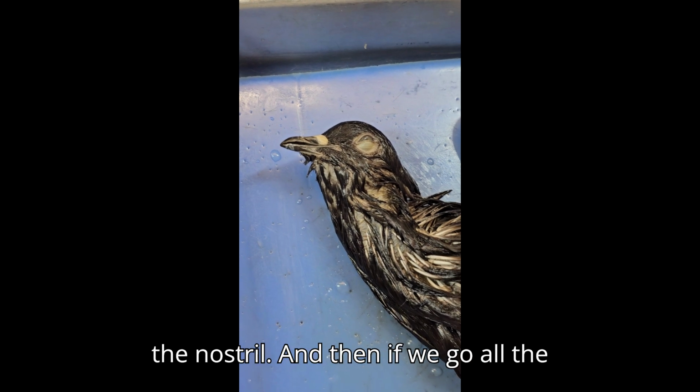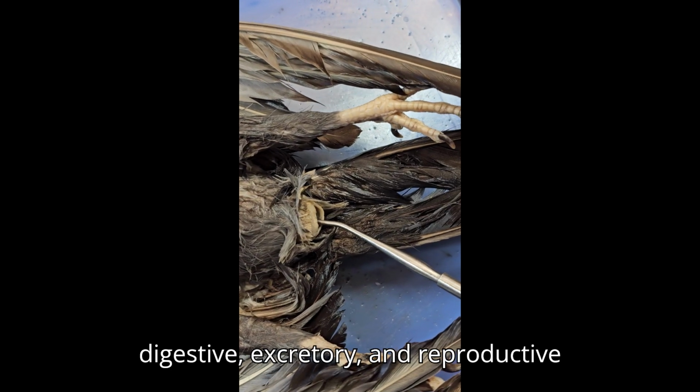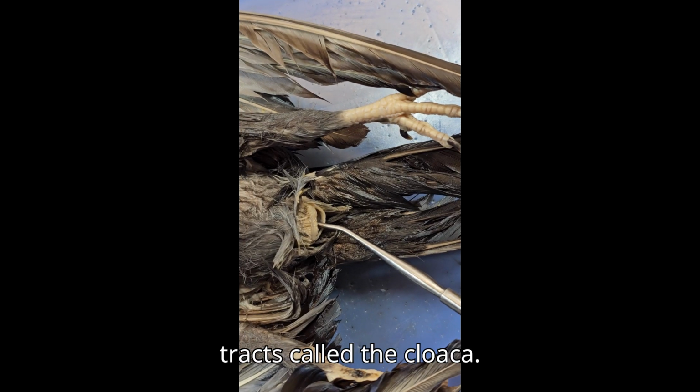And then if we go all the way to this end of the pigeon, we have a common opening for the digestive, excretory, and reproductive tracts called the cloaca.